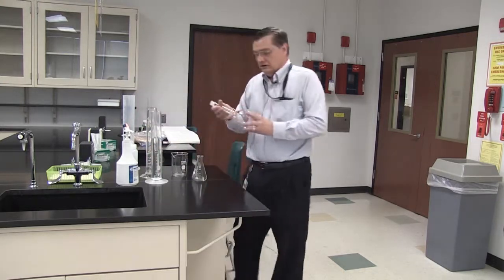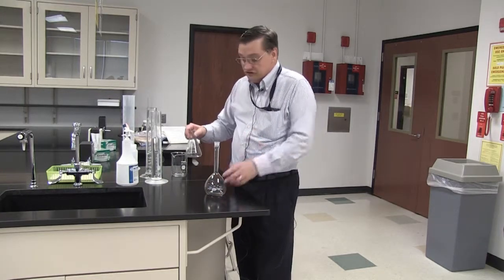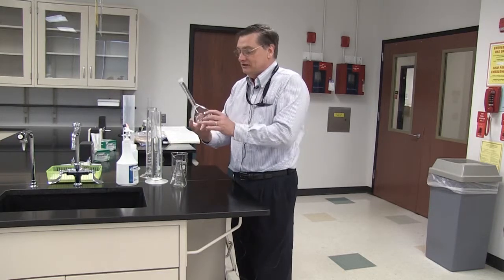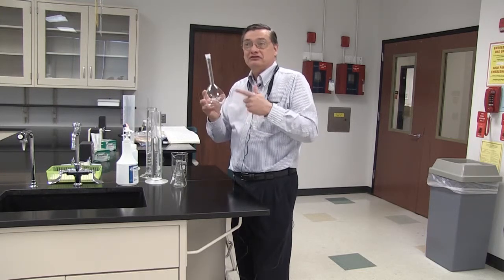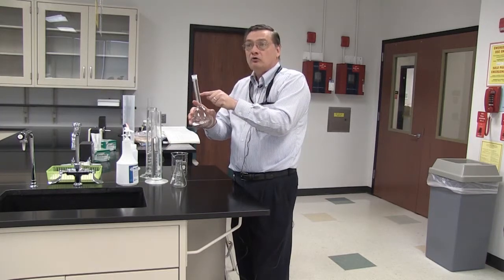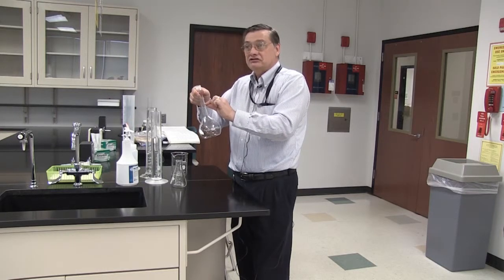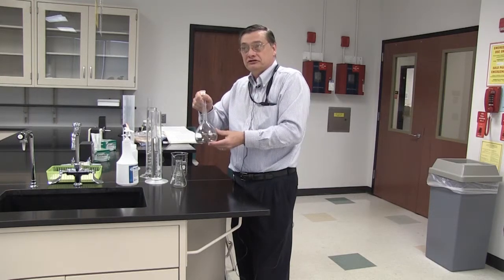Now, lastly here I have a volumetric flask. Right? Now, you'll notice it's a bit different than this flask that has the silk screened volumes on it. It has no volumes on it at all, except it says that it's a 500 milliliter flask. Notice we use the term volumetric. That means its volume is 500 mils. And if you look closely, there's a small engraved line about halfway up the neck of this flask. That line is precisely etched into the flask at that point to be precisely and accurately 500 milliliters volume.